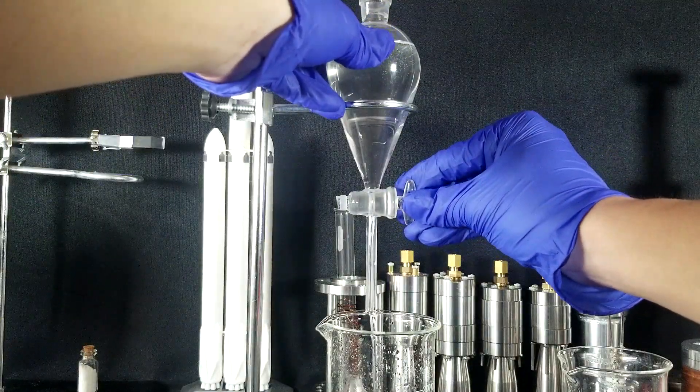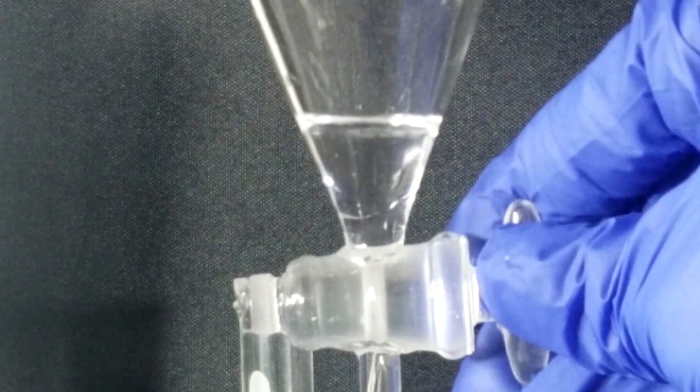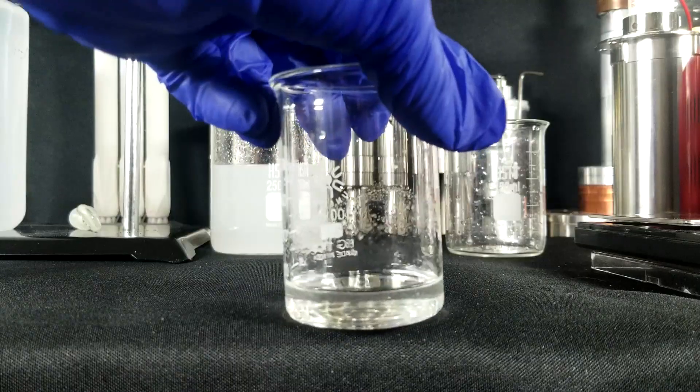After repeating the separation process five times, I see very little oil left. I called it good and stopped the separation.